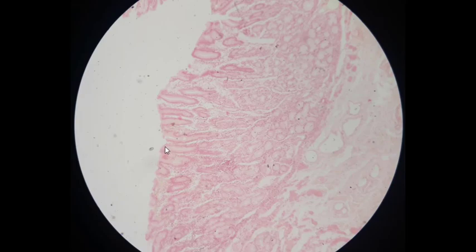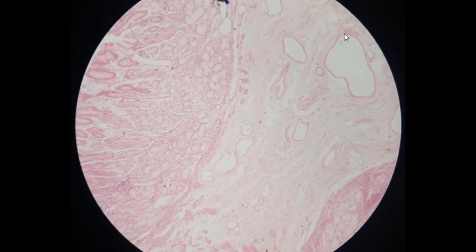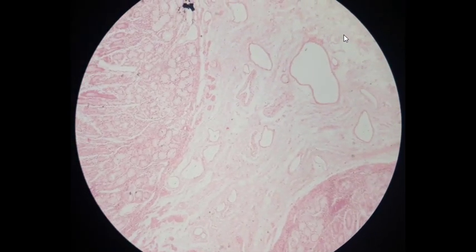Here is the mucosa, which consists of epithelium, lamina propria, and muscularis mucosa. I'll describe it in more detail in a moment. This space is the submucosa. Lots of vessels, and the cell bodies and nerve fibers of the Meissner plexus, lie within the submucosa. The Meissner plexus is not clearly visible on this slide.